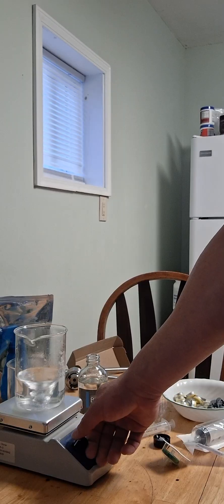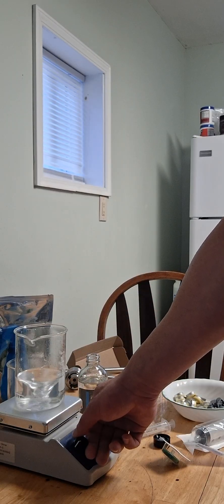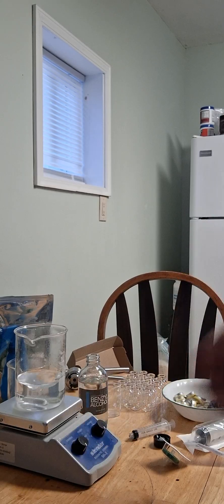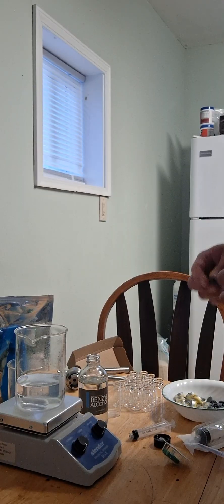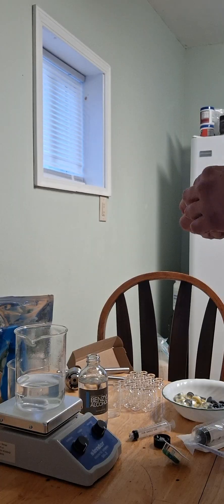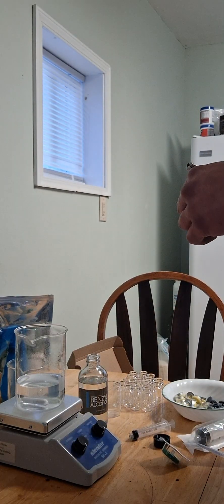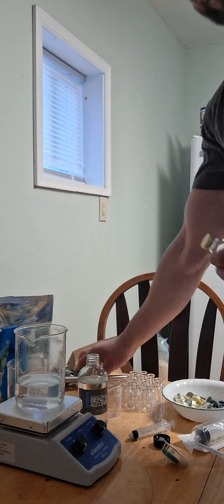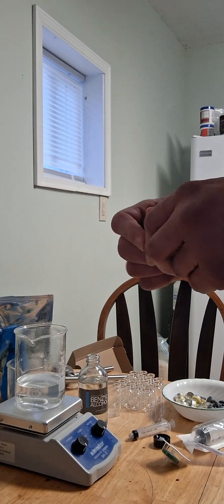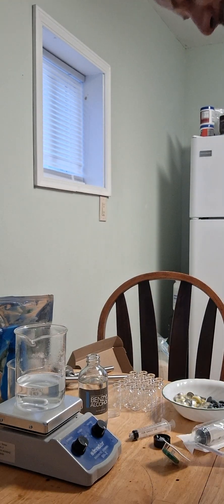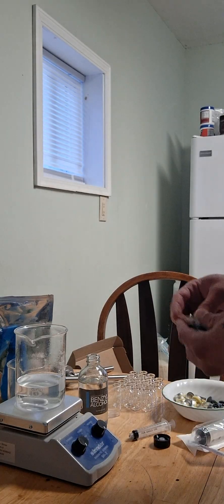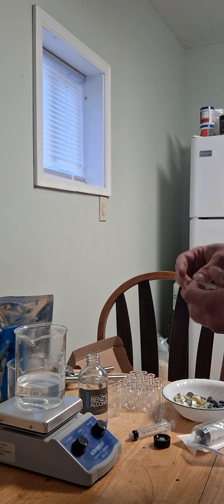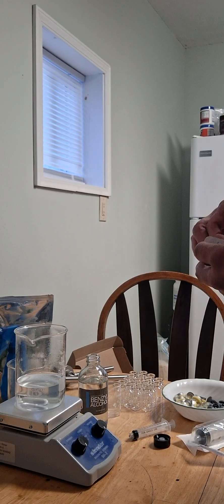Okay, since I'm showing how to do this for personal use, you would have a pre-sealed sterilized vial, so it would look something like this. When you get it, you just pop the top off.